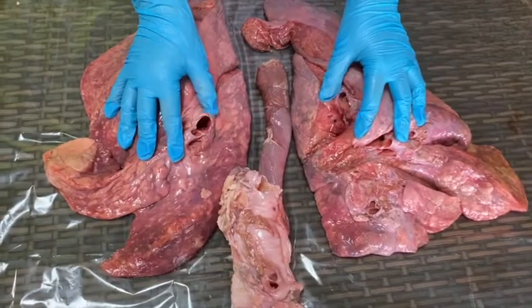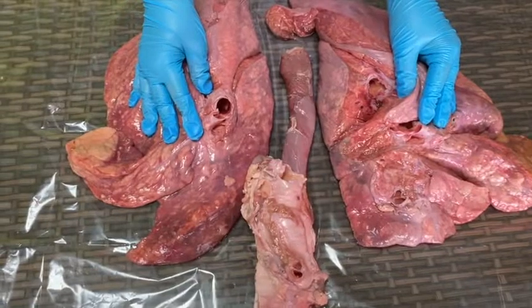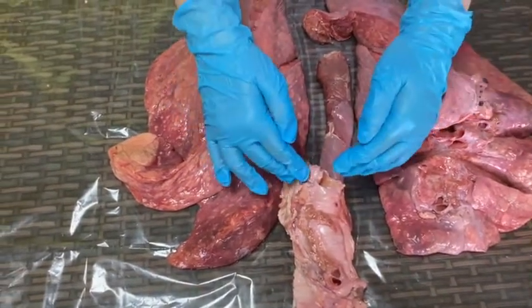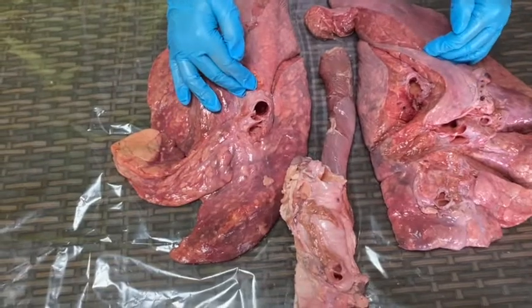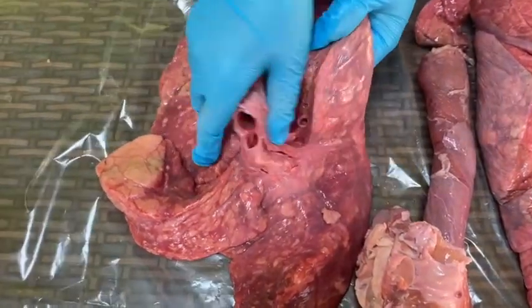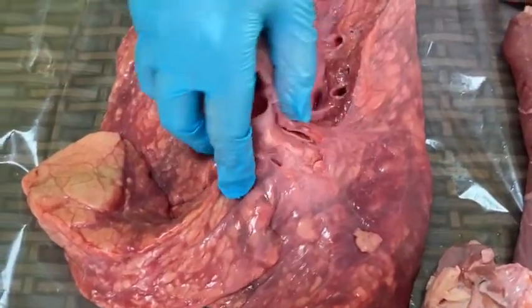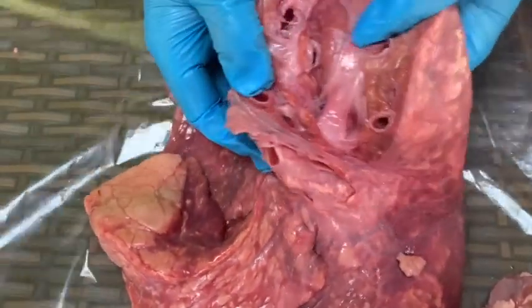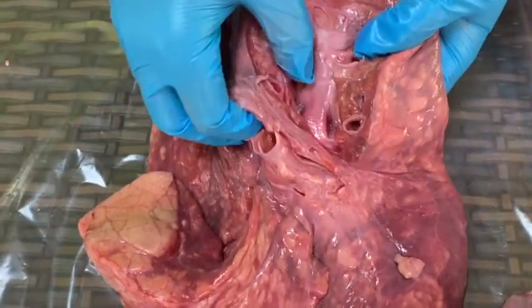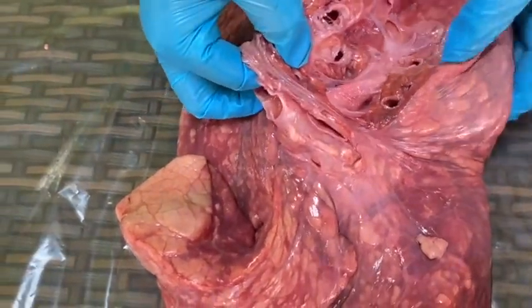Now we have the bronchi here, as you can see. The bronchi are the two main air passages into which air flows from the trachea after being inhaled through the nose or mouth. If you cut the lung, you can actually see the bronchioles, which are air passages inside the lung that branch off from the bronchi. The bronchioles deliver air to tiny sacs called alveoli, where oxygen and carbon dioxide are exchanged.